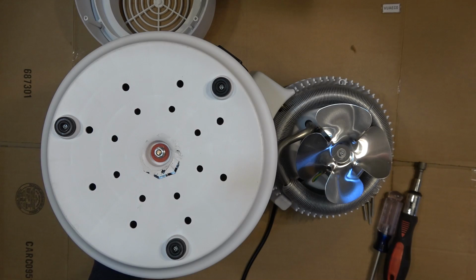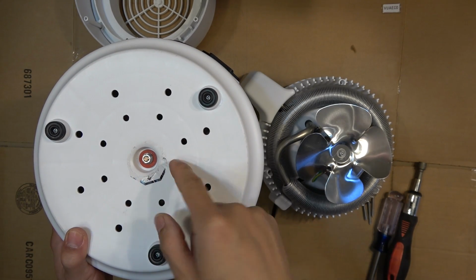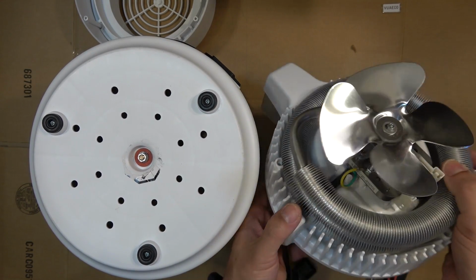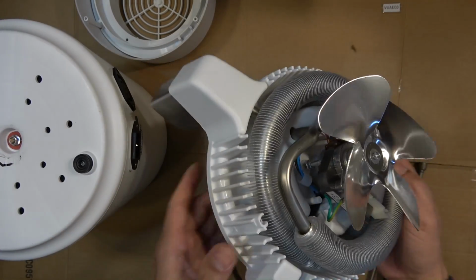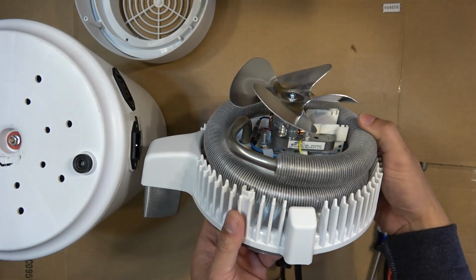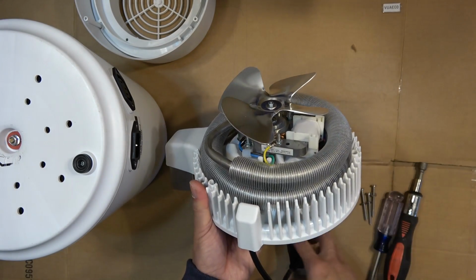The only thing that can go wrong is the temperature sensor in here, which is very easy to replace, or the fan. Not sure if this would ever break, but if it does, you can easily swap out a fan from a microwave. It looks exactly the same as a fan from a microwave. Or you can use any AC fan, I guess.